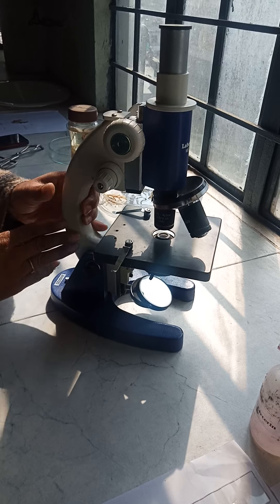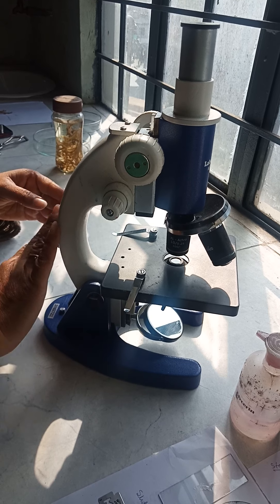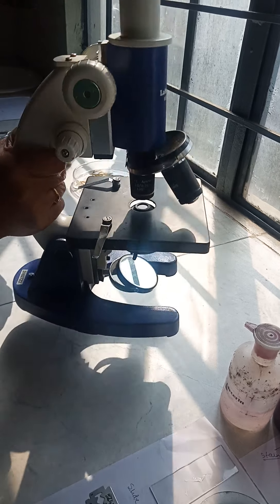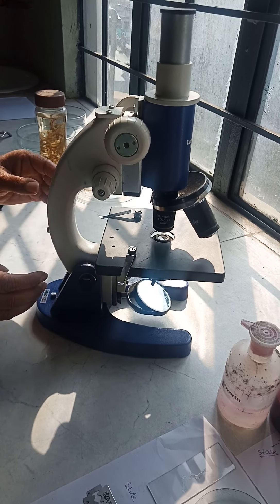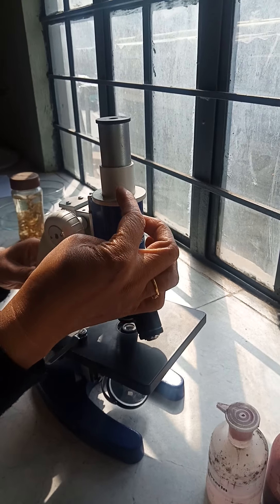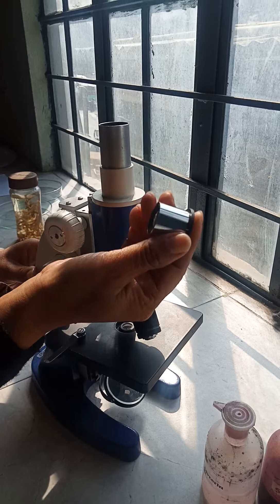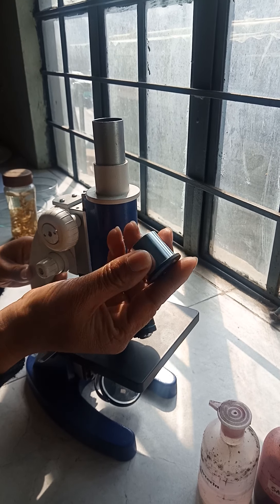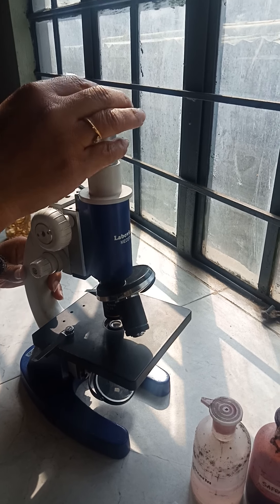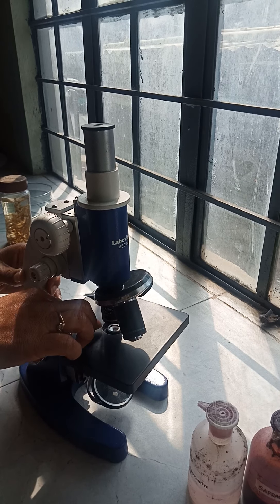The compound microscope has this curved structure here, which is called the arm of the microscope. With the help of the arm, you can carry your microscope across the lab. This is called the body or tube of the microscope. Inside this tubular structure, you have the eyepiece, which is detachable. You put your eye to the eyepiece to see what you want to observe.